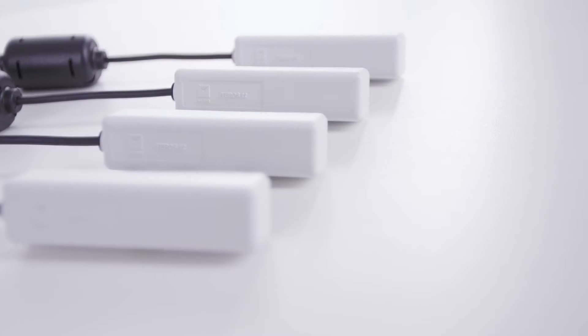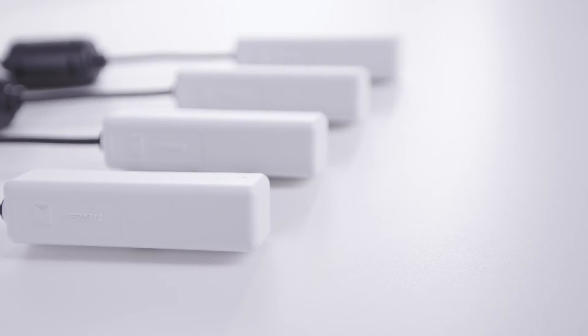Meter sensor output is very similar among sensors of the same type. You can calibrate with a single sensor and apply that calibration to other sensors of that type in your soil and maintain excellent accuracy.